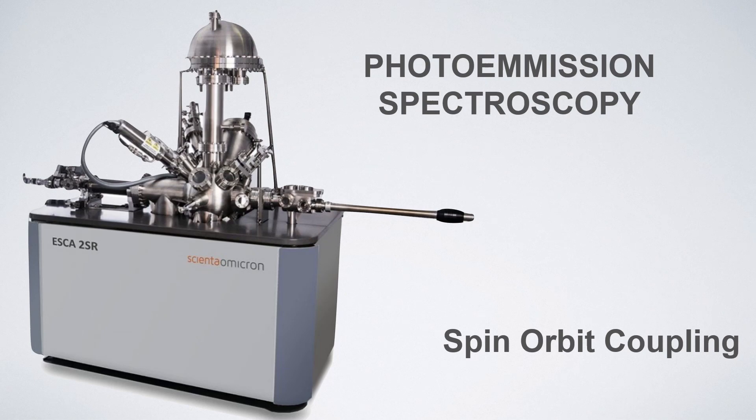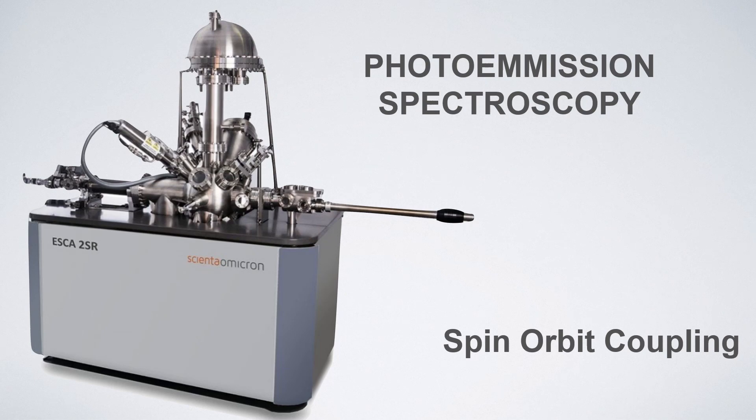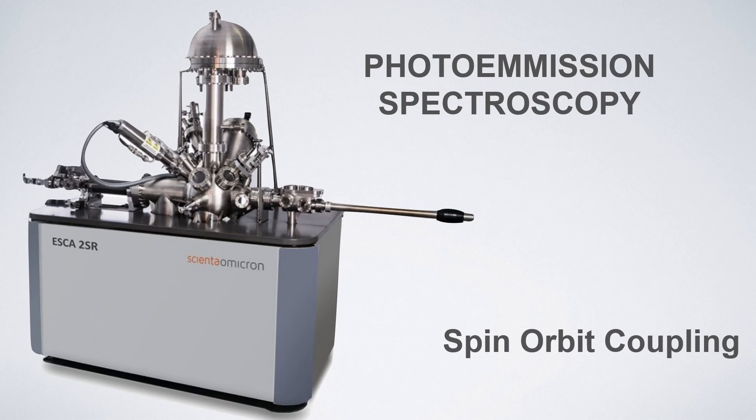Hello friends, welcome back to the series of photo emission spectra. In this video we will discuss about spin-orbital coupling of XPS data.